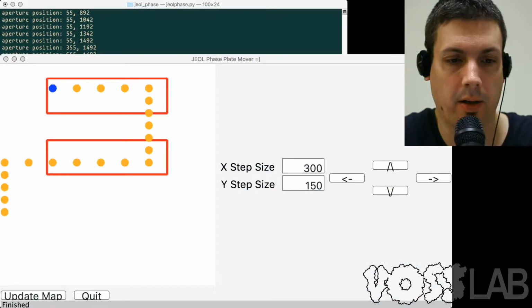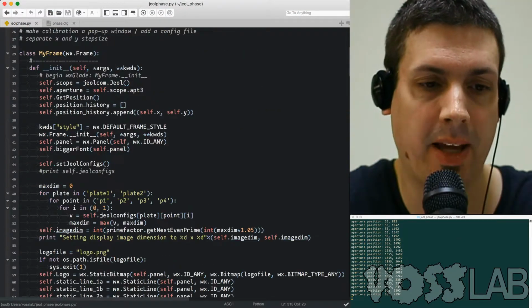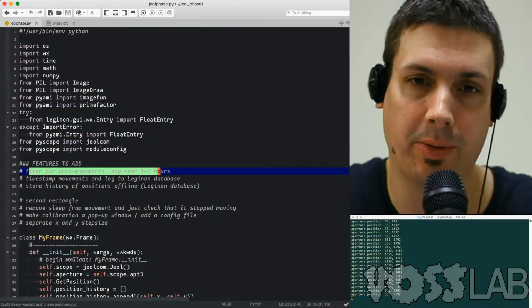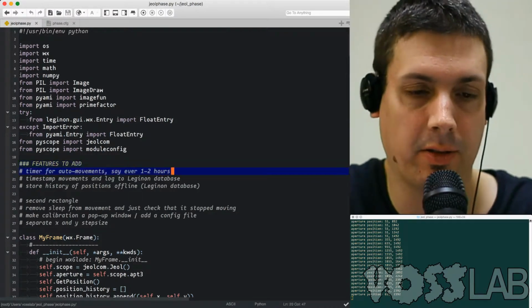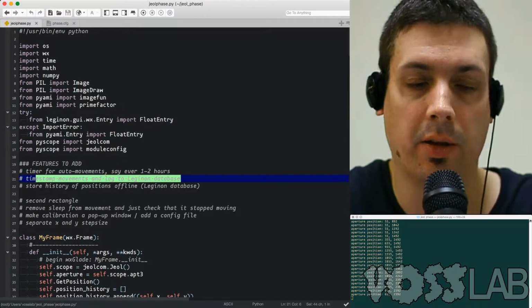Seems to be working. I do have a couple more things I need to implement. My feature set here is mainly logging, auto movements, and rather than having the user manually do this every 1 to 2 hours, which means you can't collect data overnight, using the phase plate right now, log the movements to the Leginon database.